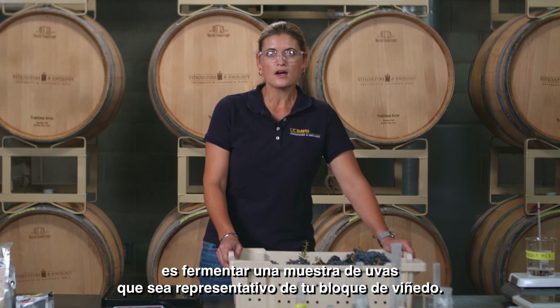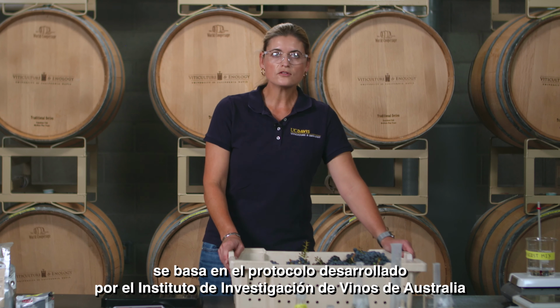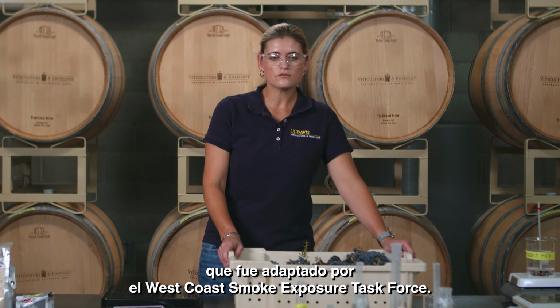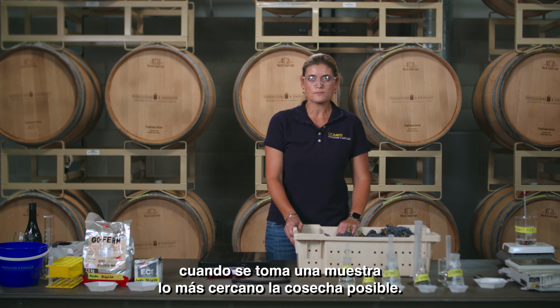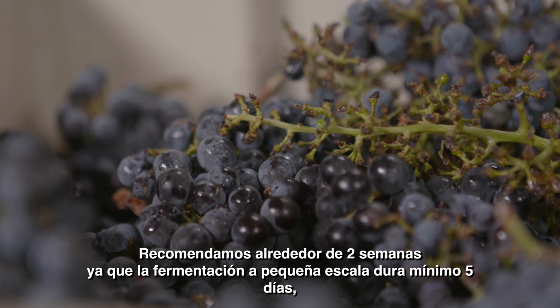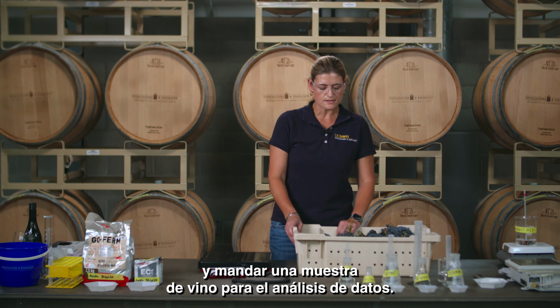The step-by-step process I'm going to follow today is based on the protocol developed by the Australian Wine Research Institute and adapted by the West Coast Smoke Exposure Task Force. Evaluating risk is most accurate if you take a grape field sample as close to harvest as possible. We recommend about 2 weeks. As your small-scale fermentation will take at least 5 days, you need to settle that wine, sensory evaluate those wines, and send a wine sample for data analysis.